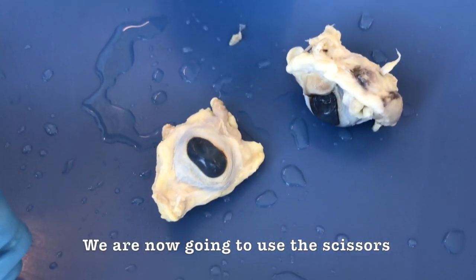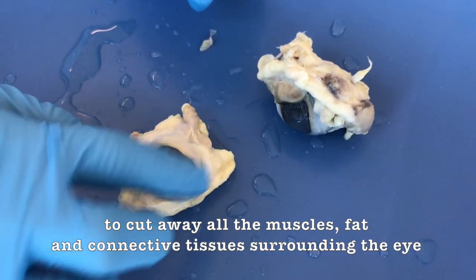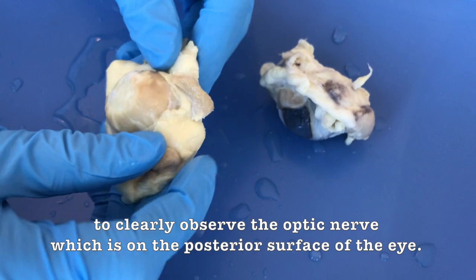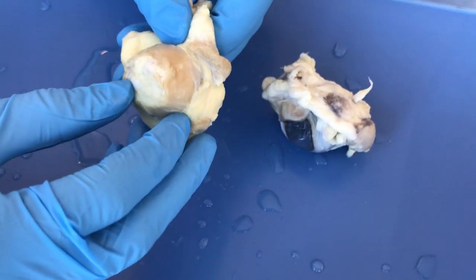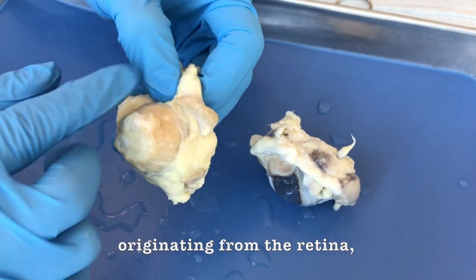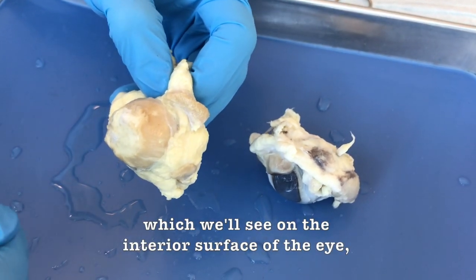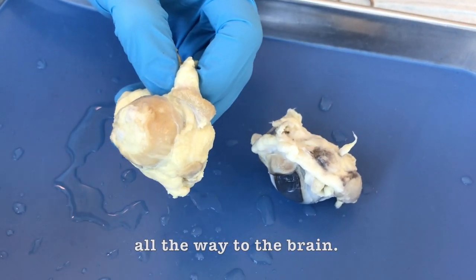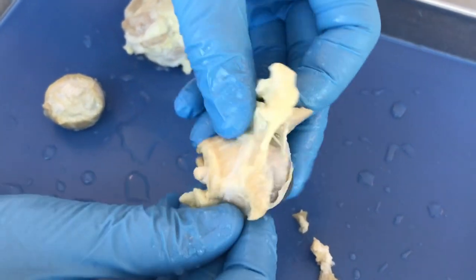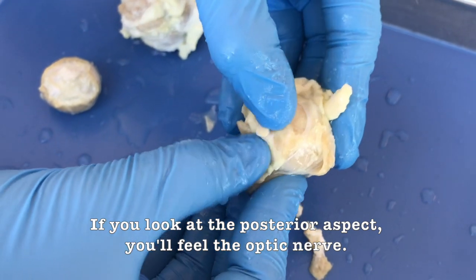We are now going to use the scissors to cut away all this muscle, fat, and connective tissue surrounding the eye to clearly observe the optic nerve, which is on the posterior surface of the eye. And the optic nerve transmits electrical impulses originating from the retina, which we'll see on the interior surface of the eye, all the way to the brain. So I'm going to show you how to identify the optic nerve. If you look at the posterior aspect, you will feel the optic nerve.